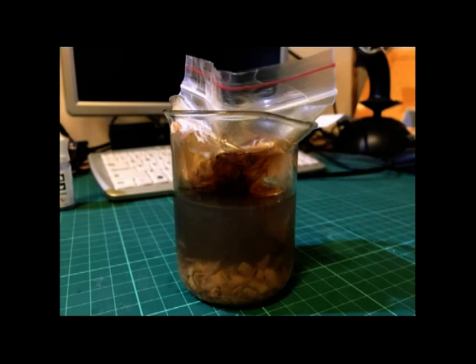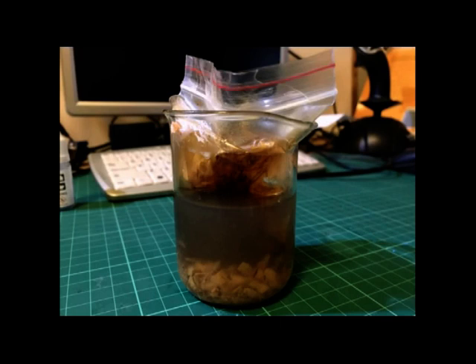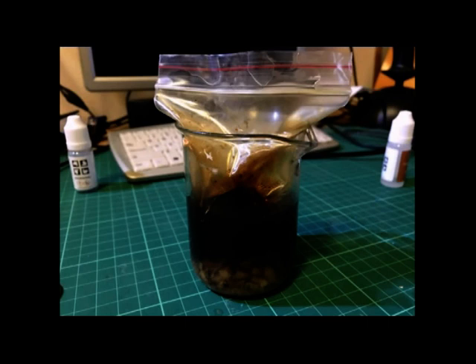Lastly, you will need to seal the packet in the starch solution and wait to see if the iodine diffuses through the packet for 10-15 minutes. Now, as you should see, the starch solution has turned blue, showing us that the iodine has diffused through.